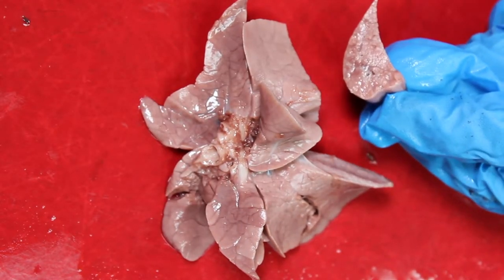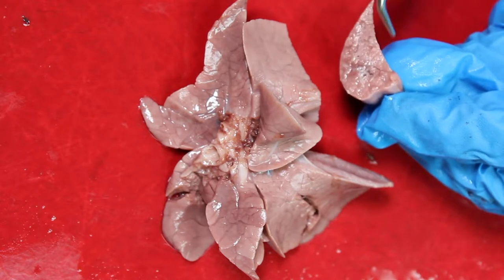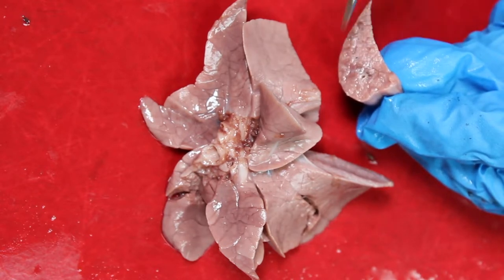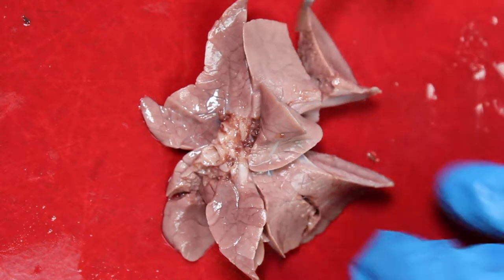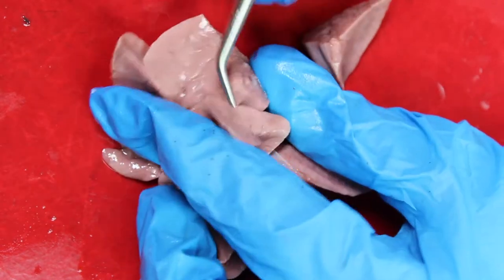The trachea and bronchi have plexuses of lymph capillaries in their mucosa and submucosa. The smaller bronchi have a single layer and they are absent in the alveoli.